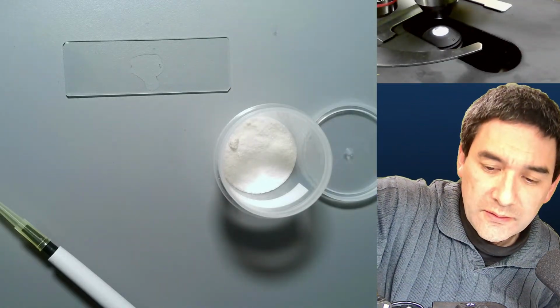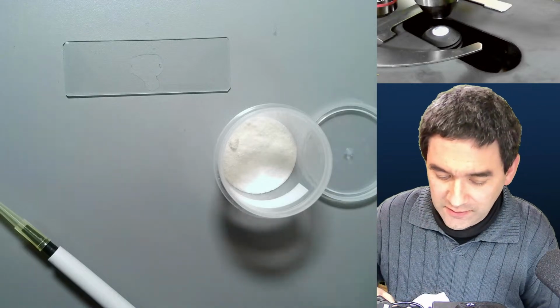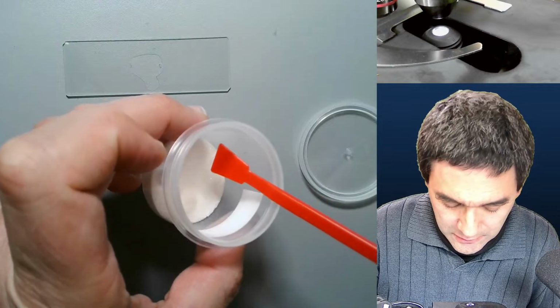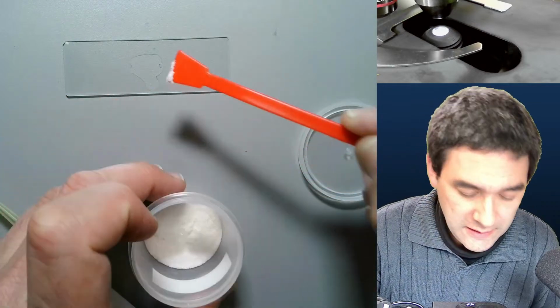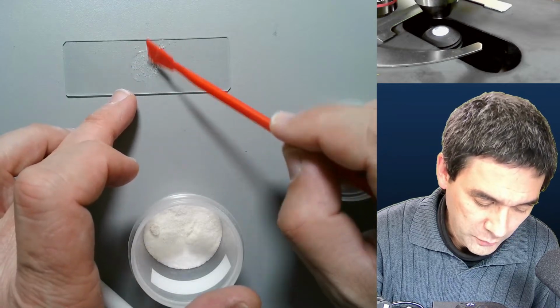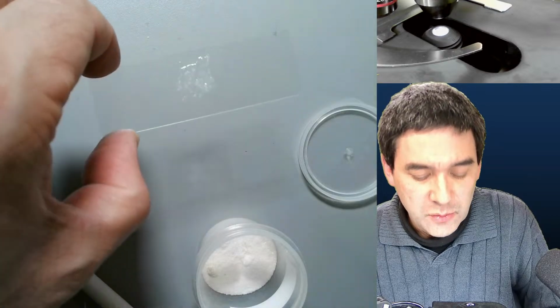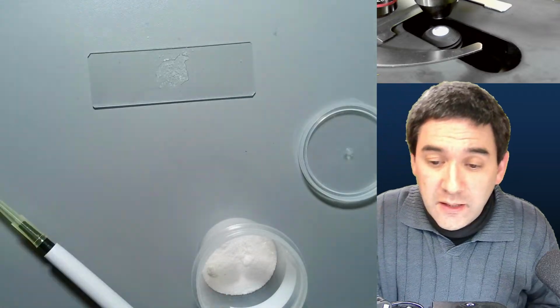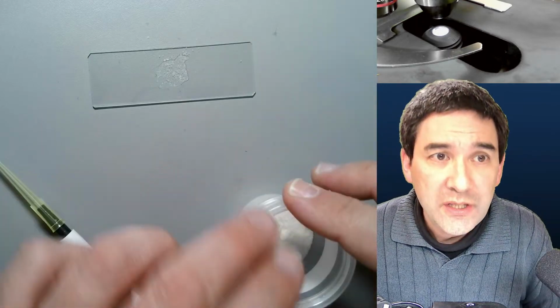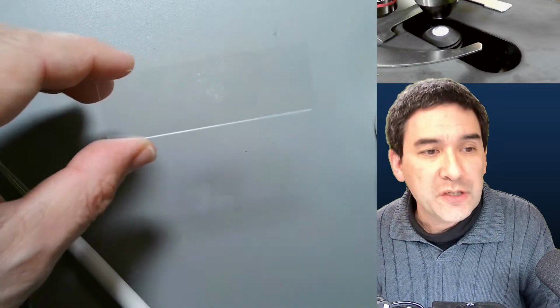I've got some water here for rinsing it, because I always want to make sure that this is clean. I take a little bit of this and I put it into the droplet of water. It will dissolve a little bit. Some of the crystals will not completely dissolve. That is fine, because these will act as so-called crystallization seeds. So crystallization will continue there. I'm going to put this under the microscope so that you see how it looks.